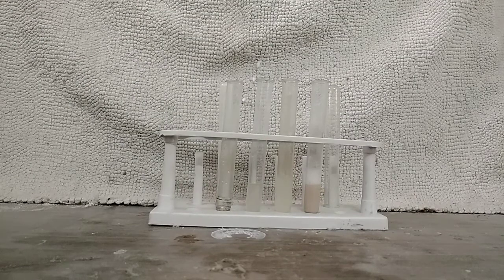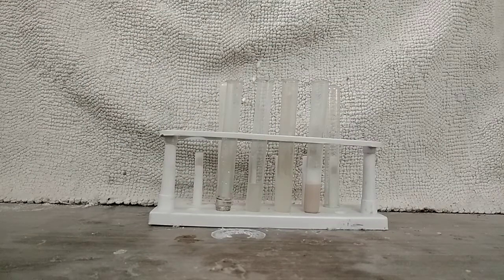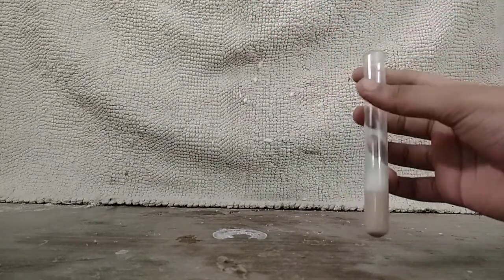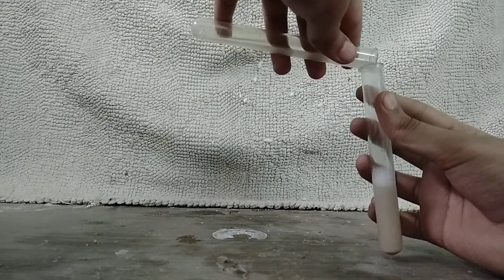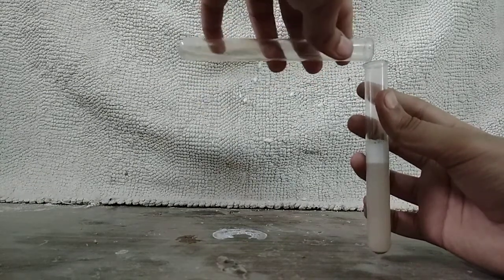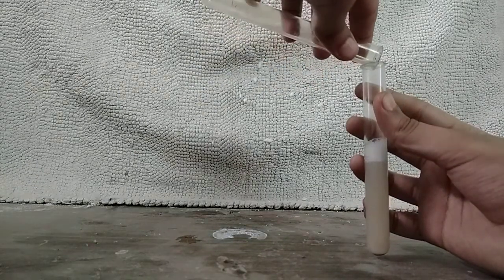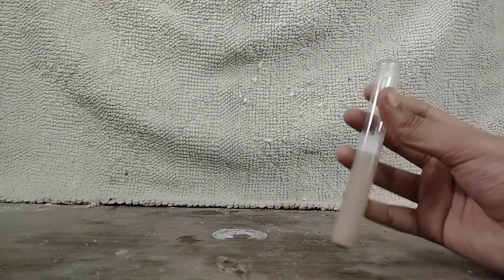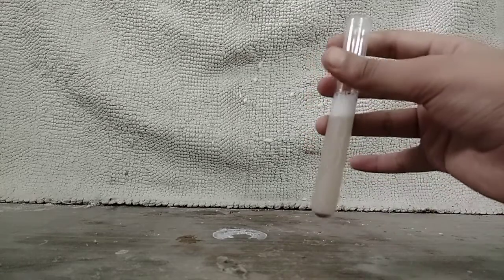You will also require some acetic acid to acidify the solution, which will be our soda extract. So first of all, let me tell you how you can prepare the soda extract. The first thing you have to do is take your toothpaste solution and add the sodium carbonate into it.